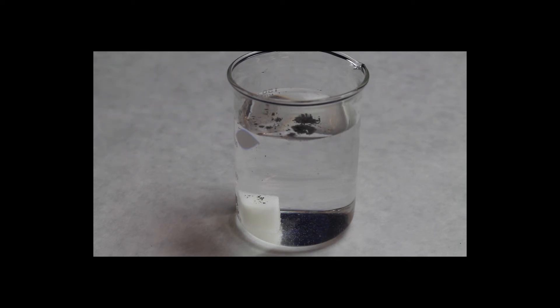This implies that sugar has similar polarity and intermolecular forces to water, while graphite has different polarity and different intermolecular forces, as it is not dissolving within the water.